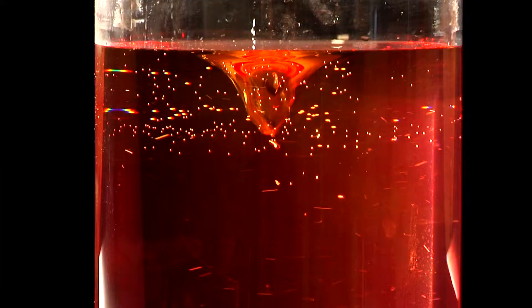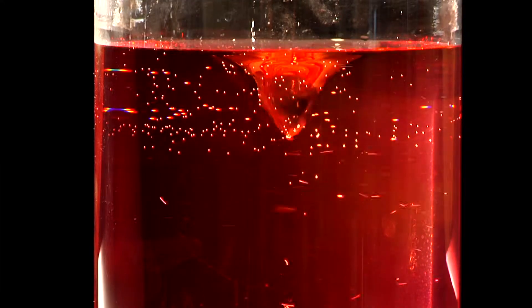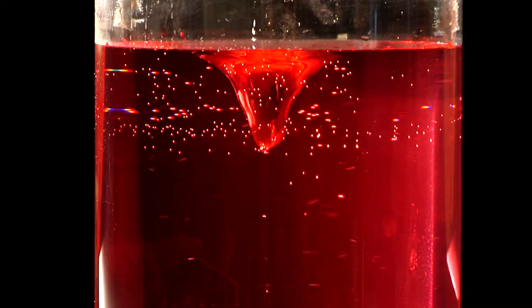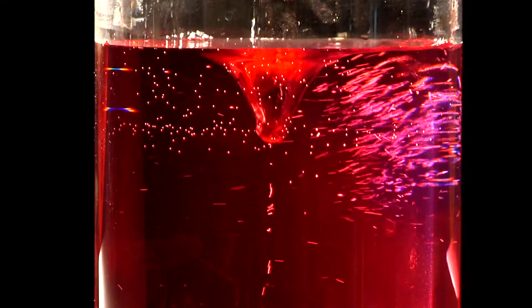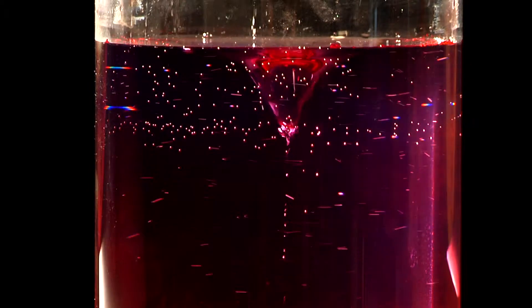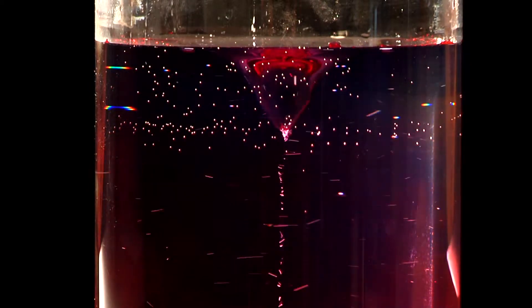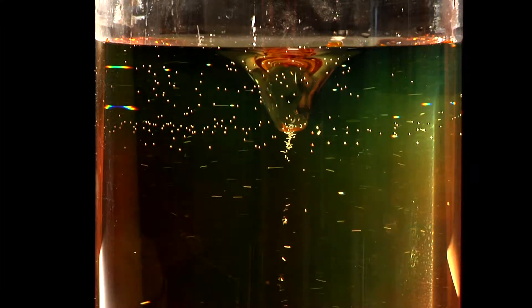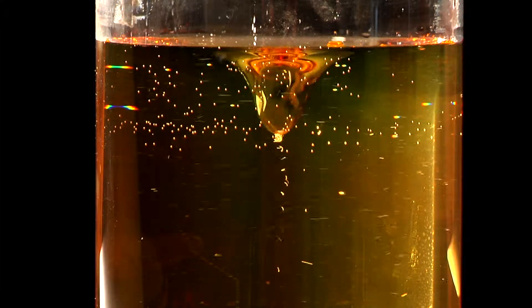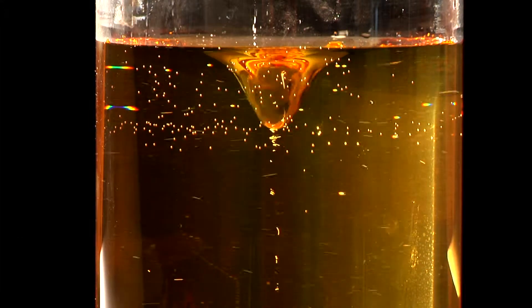Chemists describe how acid or how alkaline something is on a pH scale. The most acidic, pH 0, is seen as red. And the most alkaline, pH 14, is seen as purple. If it's green, then it's pH 7, and it's neutral.